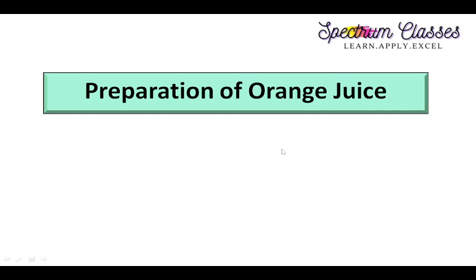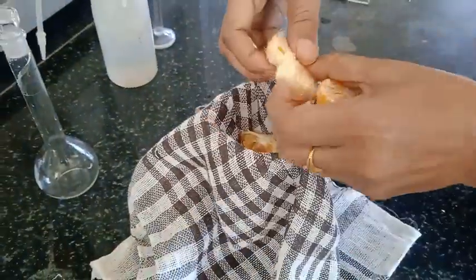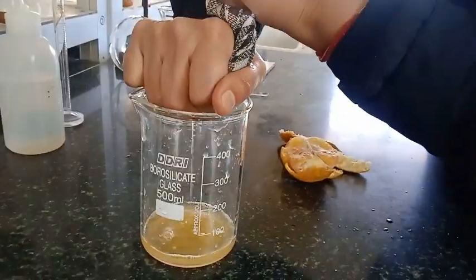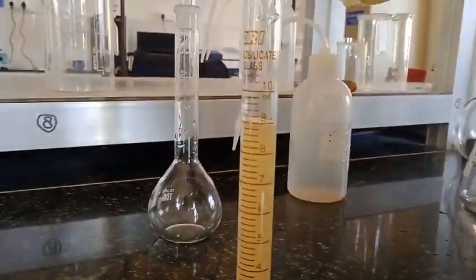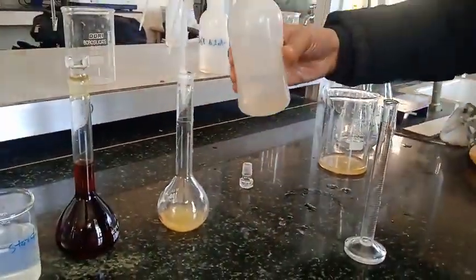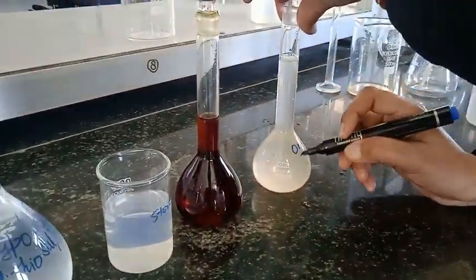The next step is preparation and extraction of orange juice. For this purpose I have taken a cloth that is washed and clean. After peeling the orange, I will squeeze it through this cotton cloth. My advice is that this should be done just before the titration process, because the juice can be oxidized. Now I am going to dilute the orange juice: 10 ml of orange juice is diluted to 100 ml. I have transferred 10 ml of orange juice to a 100 ml measuring flask — this is the 100 ml diluted orange juice solution.